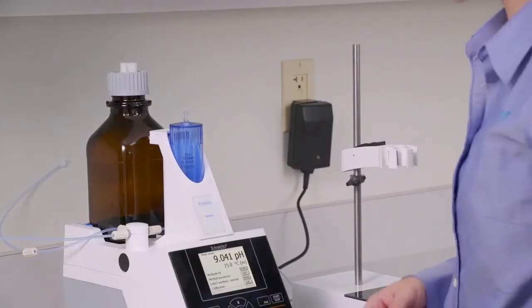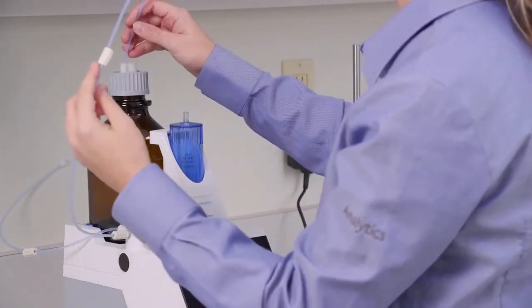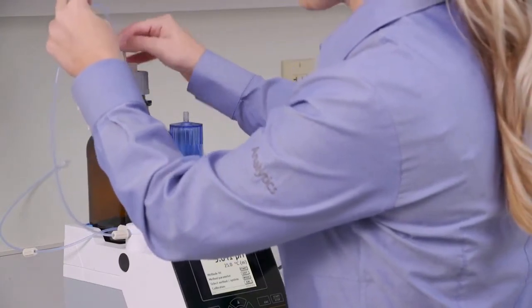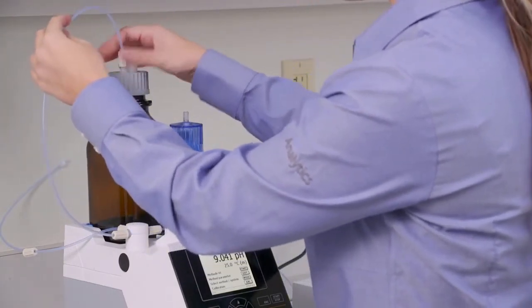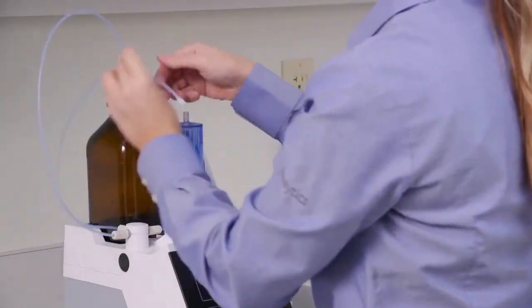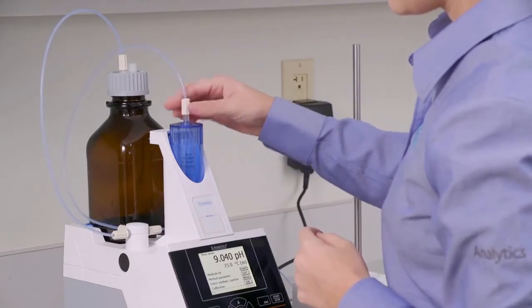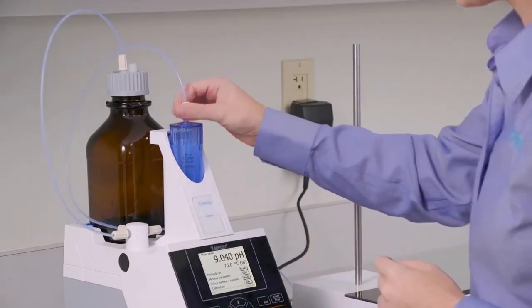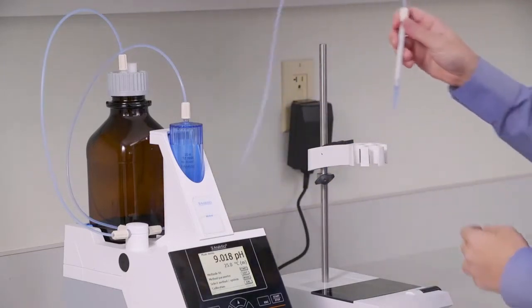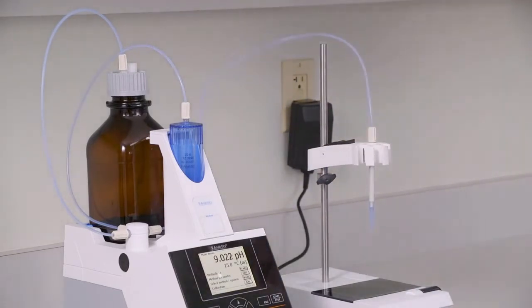Now we can get the rest of the tubing finalized. The tube on the far left side will go into the burette reservoir where the titrant is going to be. Just pull that through the bottle and then screw the thread on top. You'll do the same for the other tube that goes from the back onto the top of the burette. And the last tube with the titrant tip will just go right on top of the titration clamp like that.